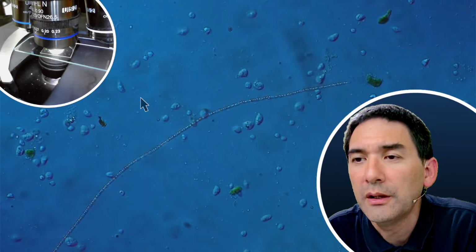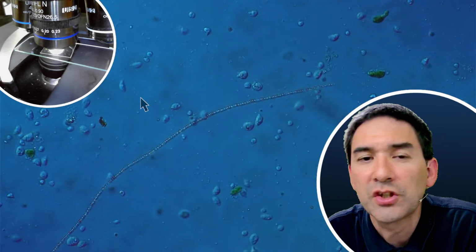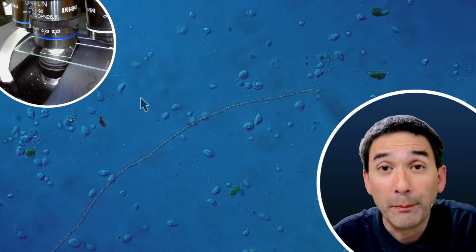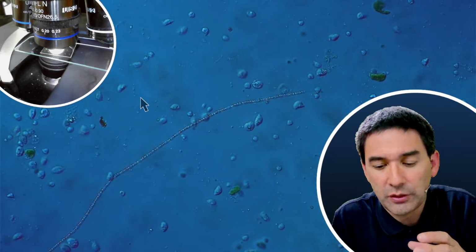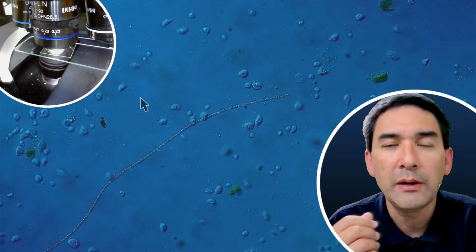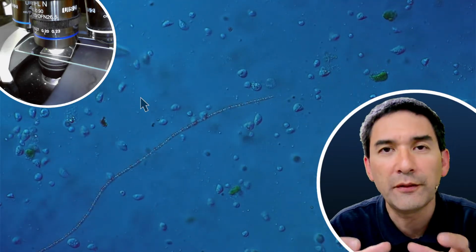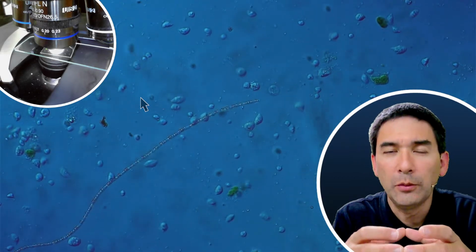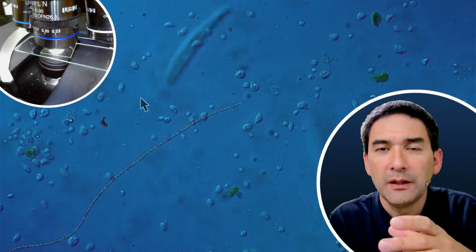Again, a question for me. Have you considered getting an inverted scope? Any benefit over upright for such specimens? The inverted scopes are those microscopes that have the optics on the bottom. With inverted microscopes, you still look from the top, but the lens is from the bottom. The reason is that you're able to put a Petri dish directly on the microscope, so you do not have to put it on a microscope slide, and you're able to look through the Petri dish from the bottom.